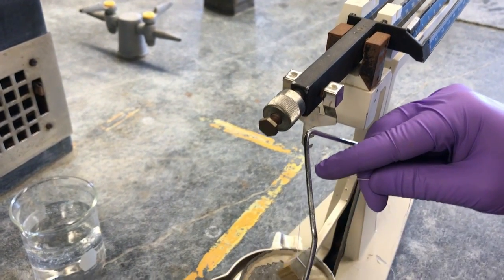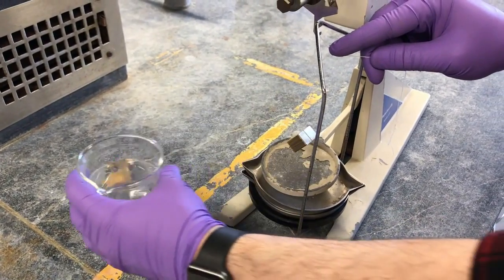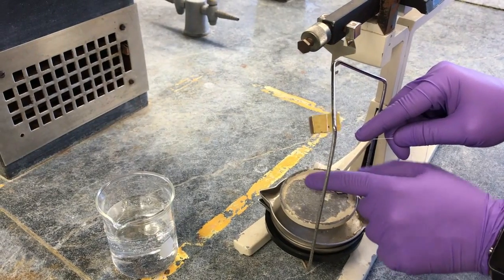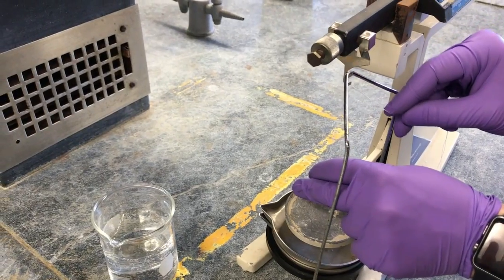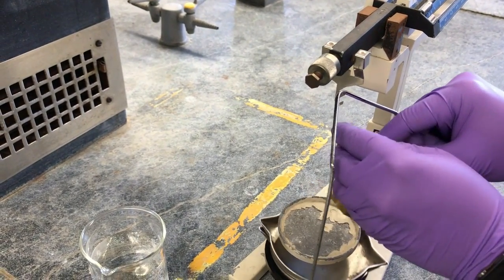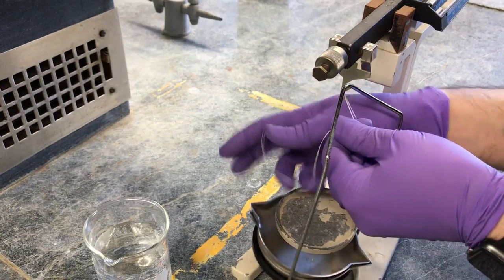What we're going to do in this next part is, we have this beaker full of water. You're going to set it on here. You want to make sure that this solid doesn't touch the bottom of the beaker, but it won't be too high that it won't be fully submerged in the water itself. So we want a nice level, probably around right here. And we're going to attempt to tie this thing in place.